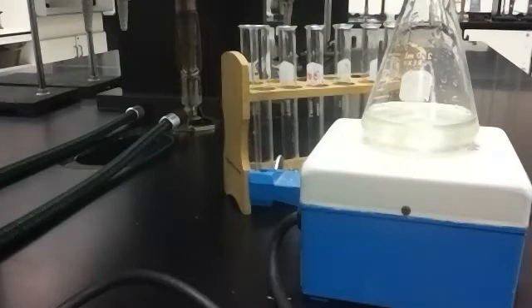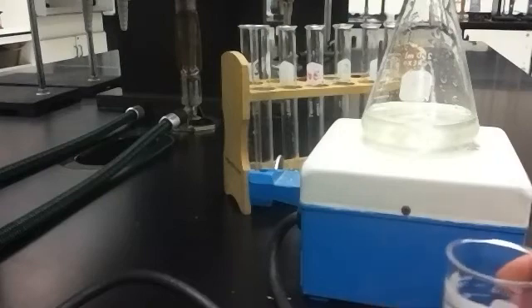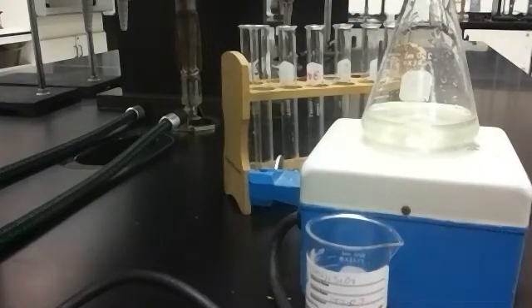Okay, so it's got a total volume of 75 milliliters. I also have a beaker, which is here. Let me get my beaker in here. Okay, this is going to be a pain. I also have a beaker, and in that beaker I have 50 milliliters of the ammonium solution that you can see there. So that beaker is described in the paragraph down below.